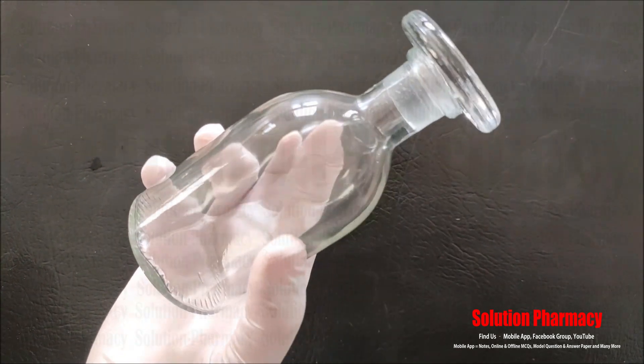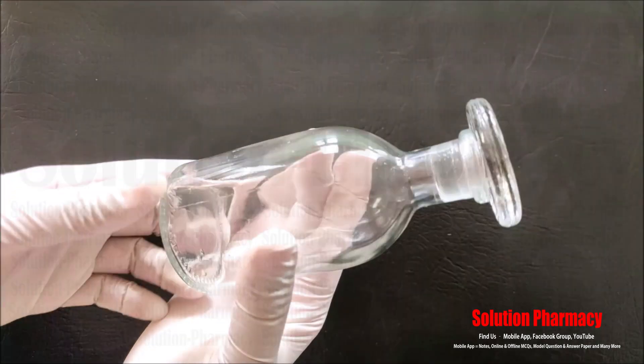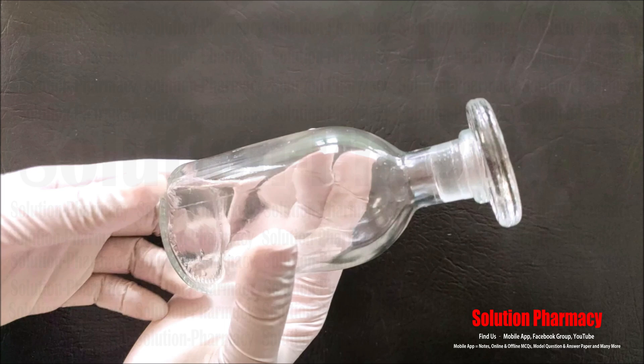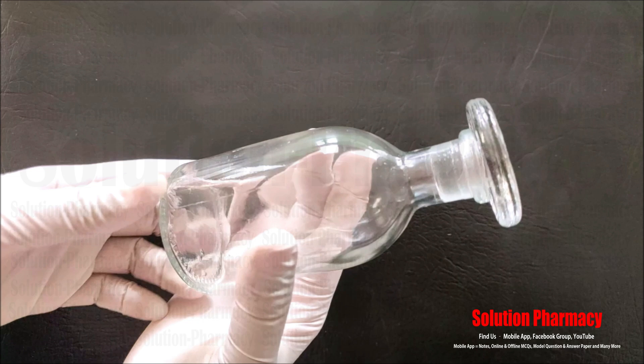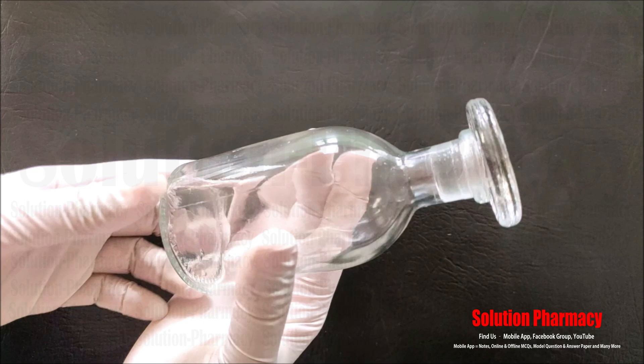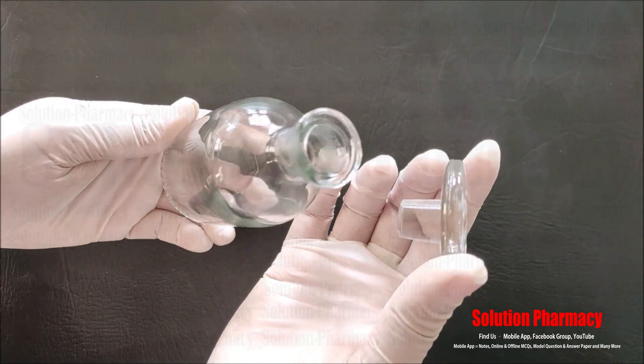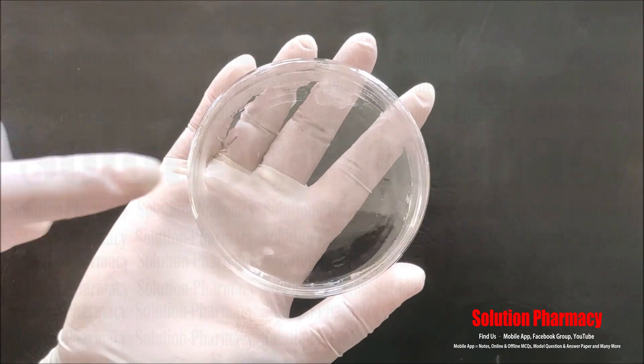Next, this glassware is called a reagent bottle. It is used to store different chemical reagents like acids and alkalis — dilute nitric acid, dilute sulfuric acid, dilute ammonia solution, and other detecting reagents used for chemical identification tests. Chemicals are stored in either liquid or powder form. The glass of this reagent bottle is anti-corrosive, meaning chemicals can be stored for a long time without corrosion. It has a cap or stopper at the top.